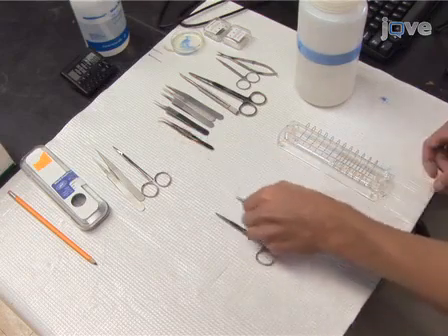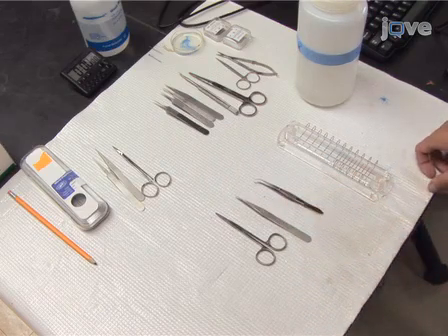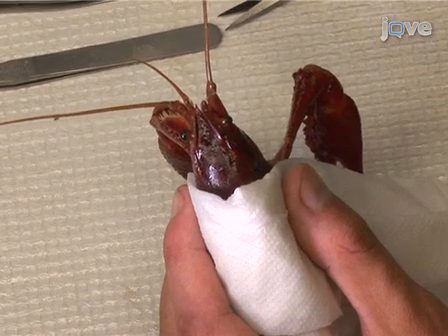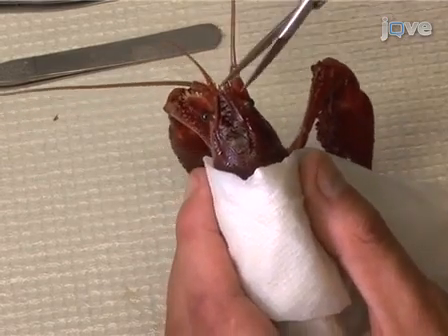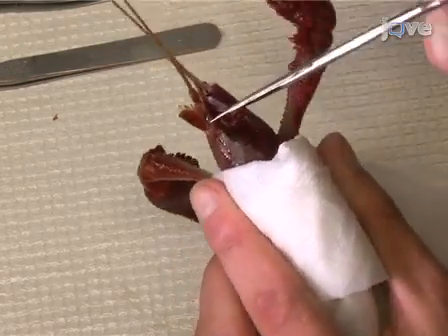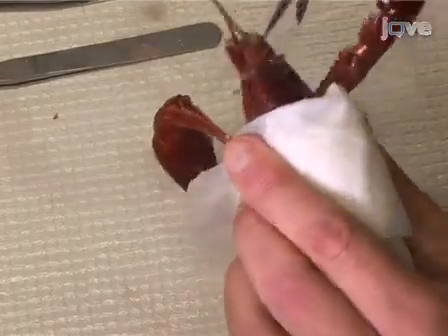To obtain the ventral nerve cord of the crayfish, first prepare the nerve dish, dissection instruments, and saline solutions. Place the crayfish on ice for about 5 minutes to anesthetize it. Once anesthetized, wrap the crayfish in a moist paper towel and hold the crayfish in one hand with its claws between your thumb and forefinger. Using the other hand, make an incision with the scissors through the rostrum between the eye sockets. Cut downward from the incision until the head is completely severed.